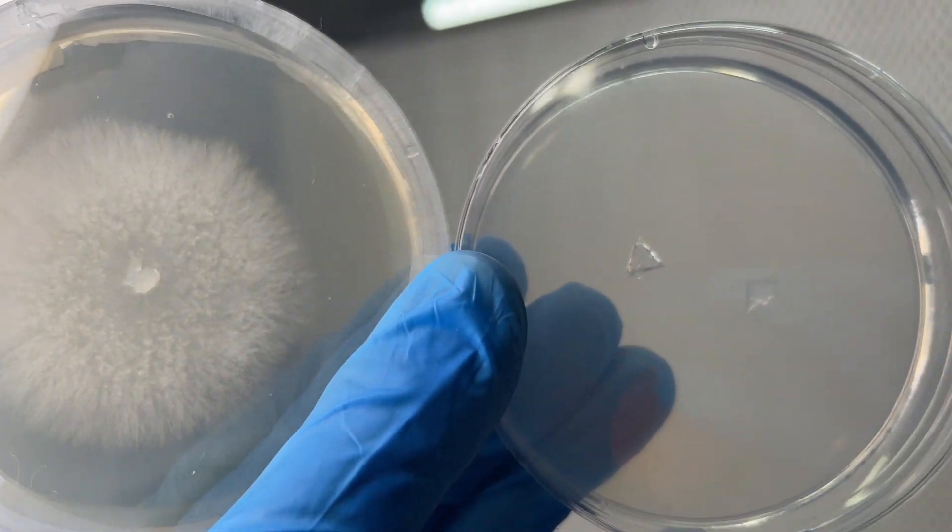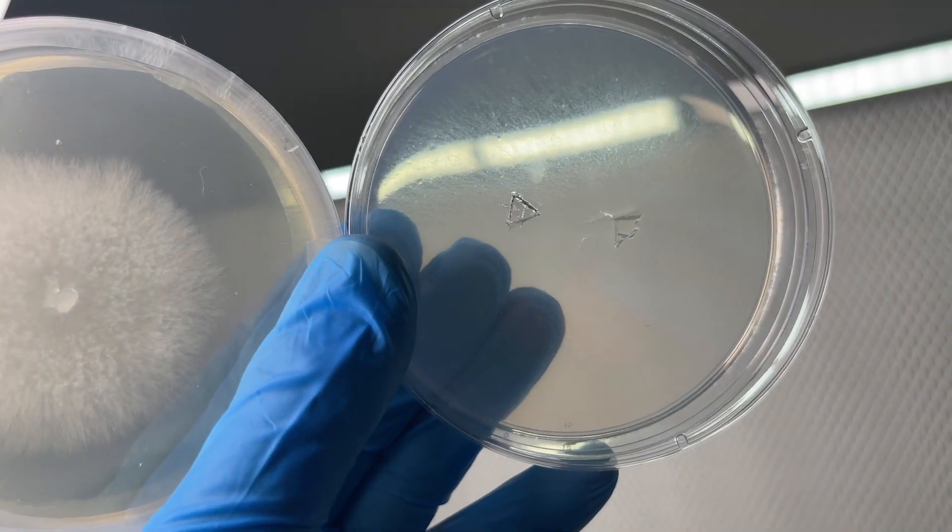After about one week of growth, you can already see that the mycelium is much more aggressive on the nutrient agar plate.